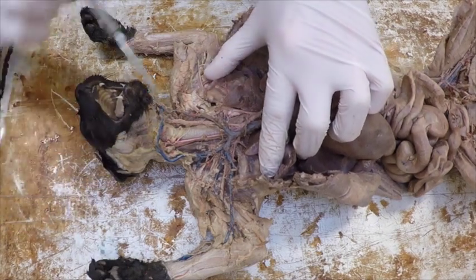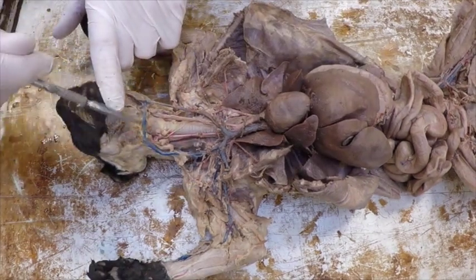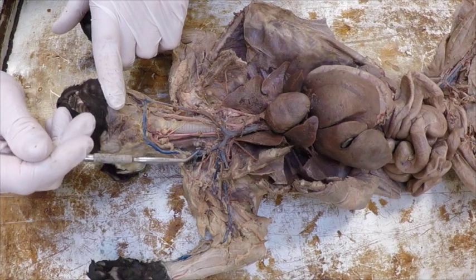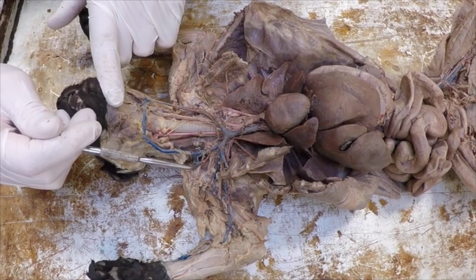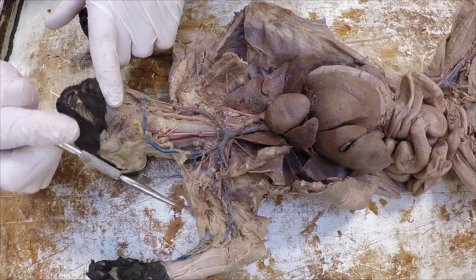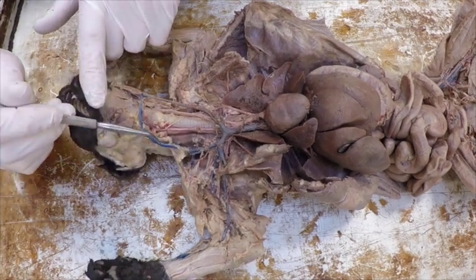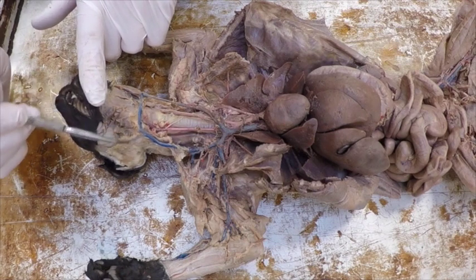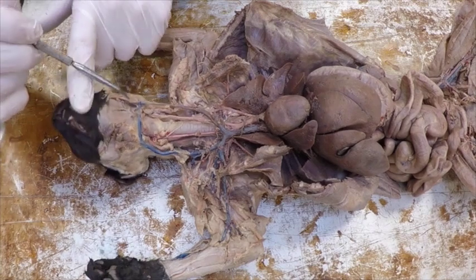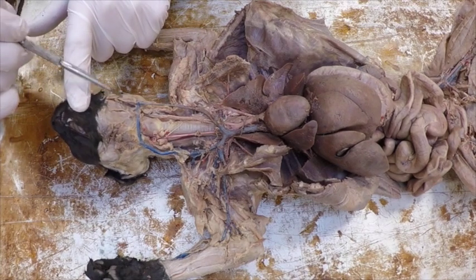This up here on the top is my transverse jugular coming off this external jugular, and I would guess that that was probably my transverse scapular, but I'm not positive, being that I didn't pull it out originally. If we kept going up with the external jugular, once we get to the transverse, we would have the anterior facial, which would keep coming up this way. Theirs doesn't seem to have injected very well, but you can see the anterior facial.